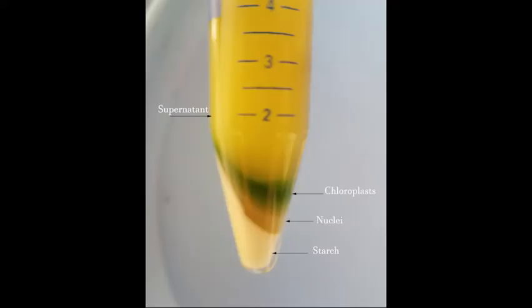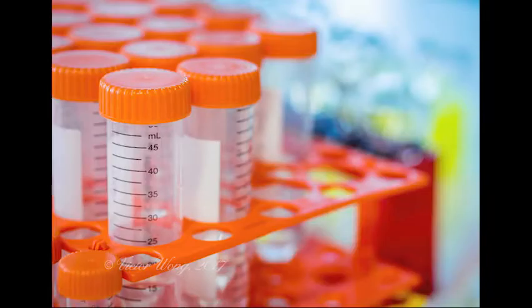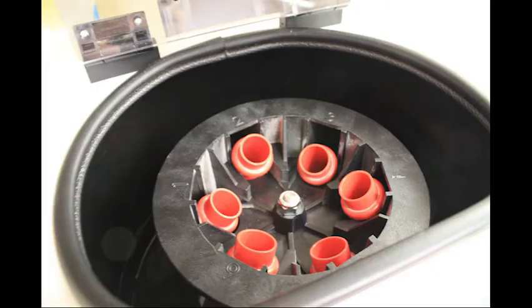Centrifugation is a technique used for the separation of particles from a solution according to their size, shape, density, viscosity of the medium and rotor speed. The particles are suspended in a liquid medium and placed in a centrifuge tube. The tube is then placed in a rotor or centrifuge machine and spun at a predefined speed.